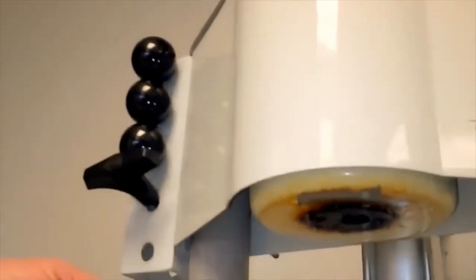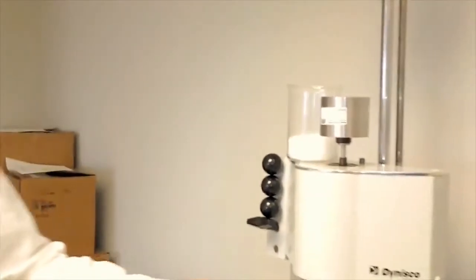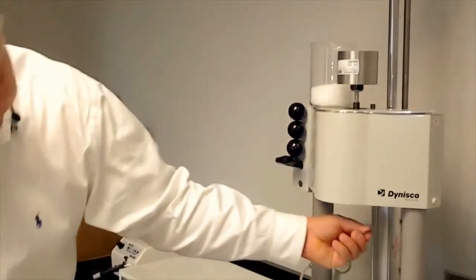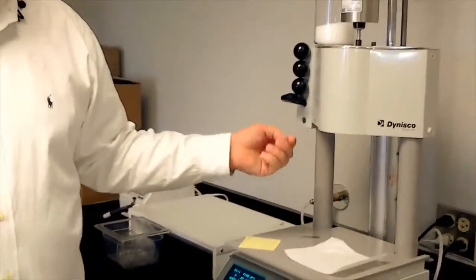So, what happens is after this amount of plastic melts in about 6 minutes, after we measure and cut off with a razor blade, how much plastic comes out at the bottom after 10 minutes.